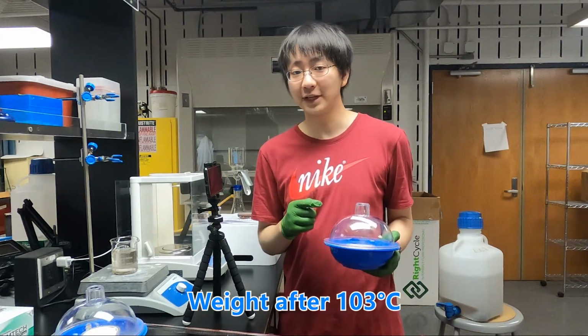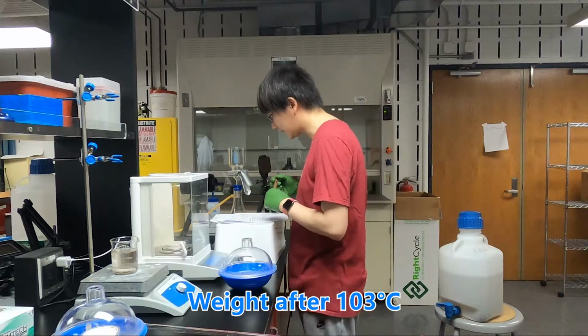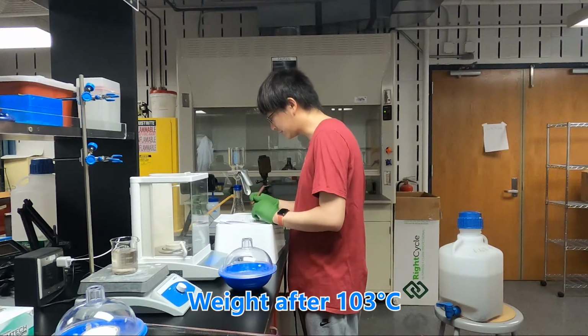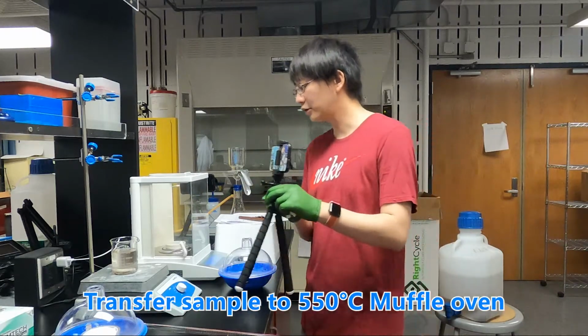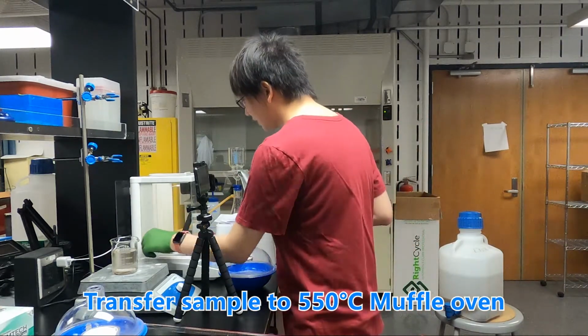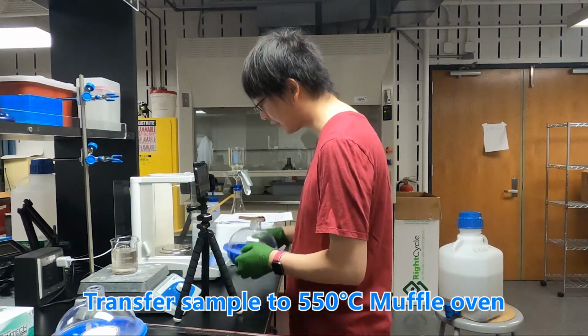And now it is after 10 minutes. We are going to measure the weight of this and write down the mass after 103 Celsius degrees. And after this, we are going to bake it in a 550 Celsius degree muffle oven.